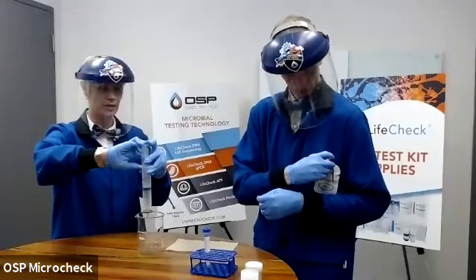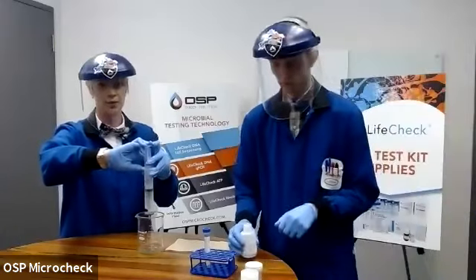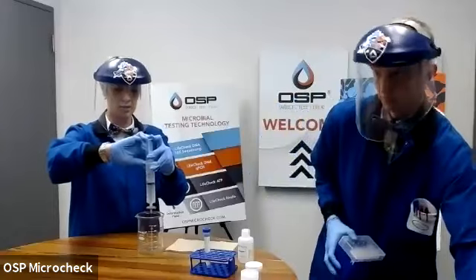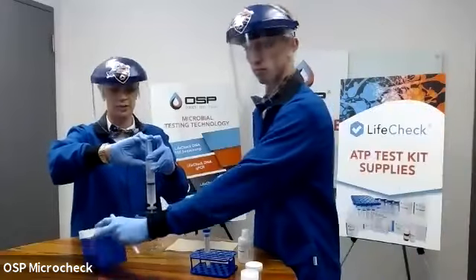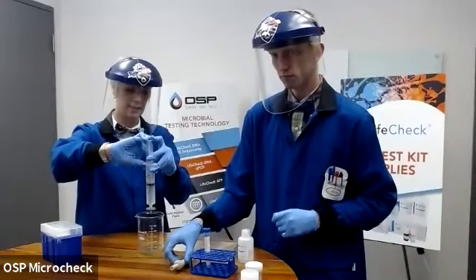Now I am putting a lot of pressure on this because that last sample was particularly nasty. We did want to make sure that we use representative samples that we may see in the field as a worst case, so you can see some of the challenges. So I'm just holding pressure on this and allowing it to drip through. Again, every drop is getting a little bit clearer, which means I am cleaning it up, and that's what's important.